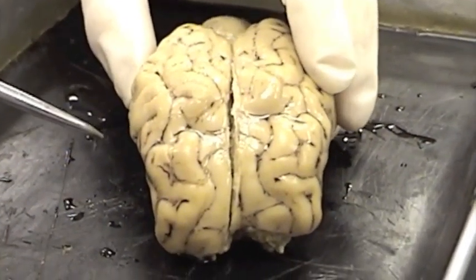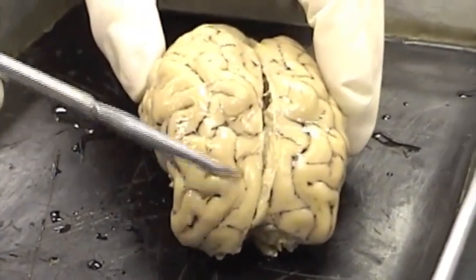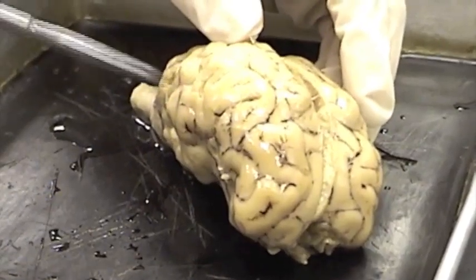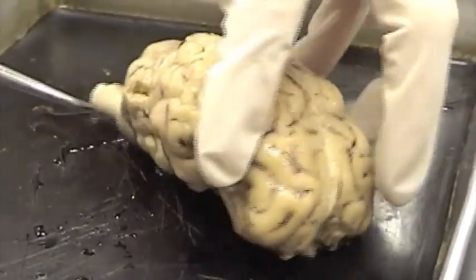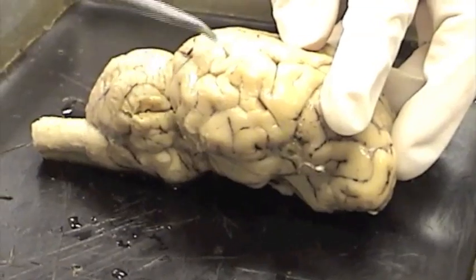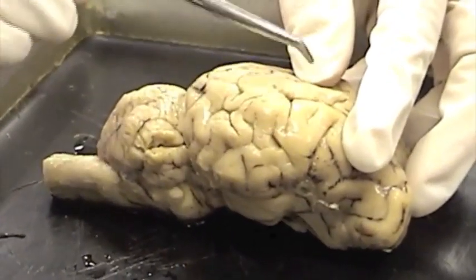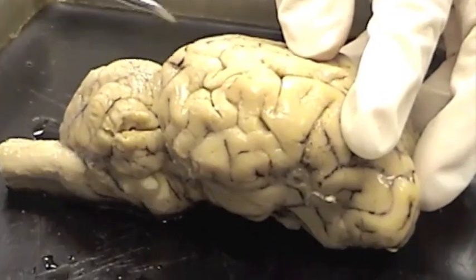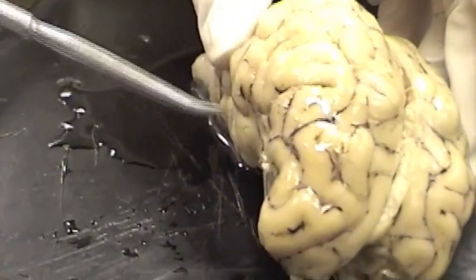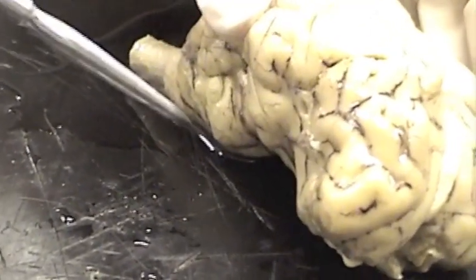The cerebrum can further be divided into lobes. Here is the frontal lobe, here is the temporal lobe right around in that region. Here is the occipital lobe, and in this region would be the parietal lobe, and of course it's the same on the other hemisphere. On the sheep brain the lateral fissure is not well enough developed to point out.